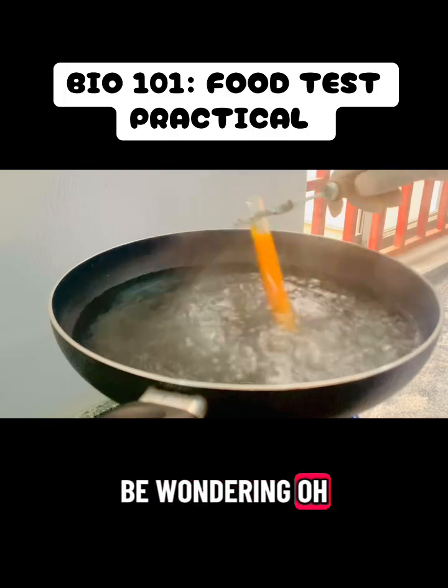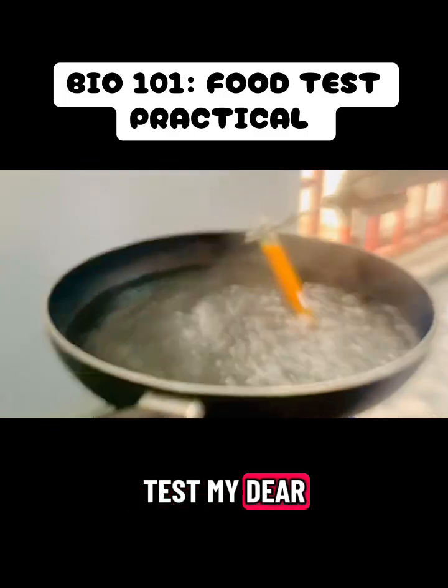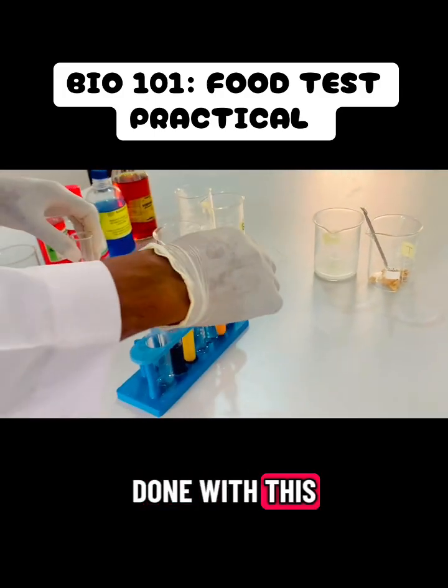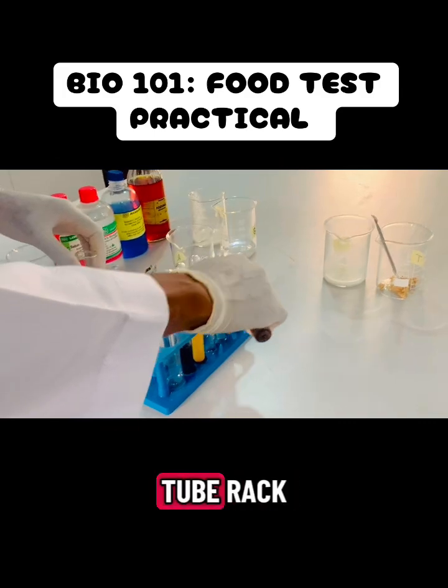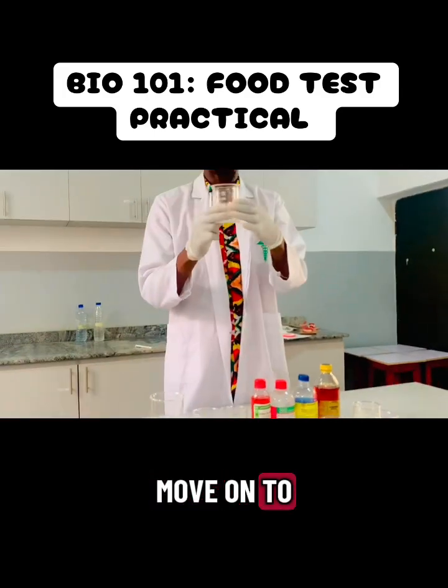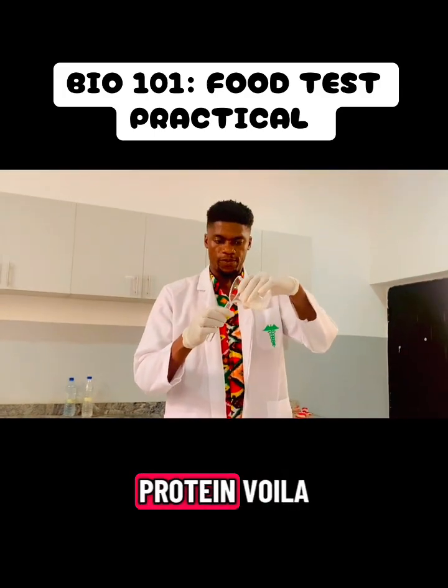So you may be wondering, oh, food test. My dear, this is what we do in our lab. Okay, so we are done with this. So we have to place it in the test tube rack. Yep. So we move on to protein.